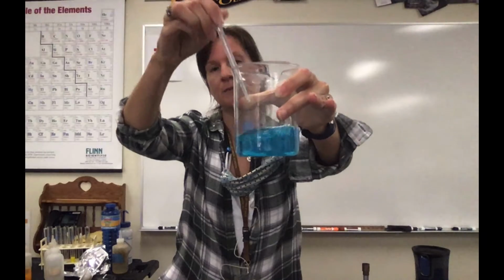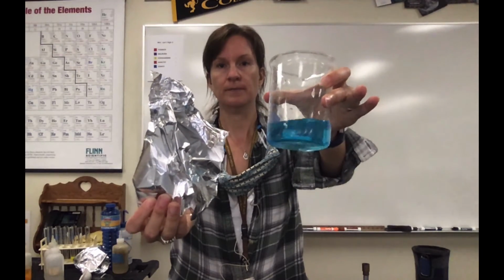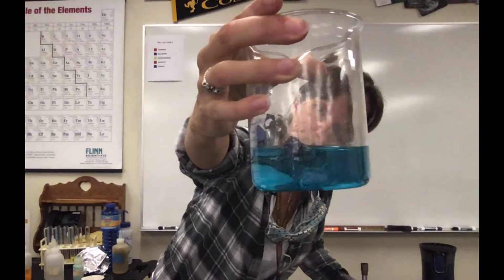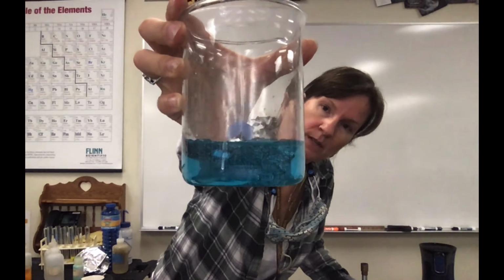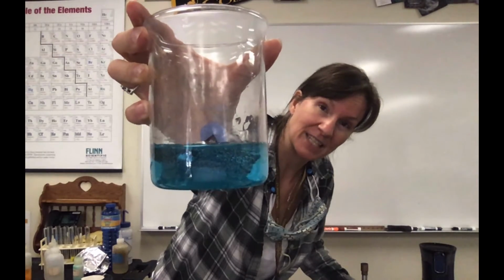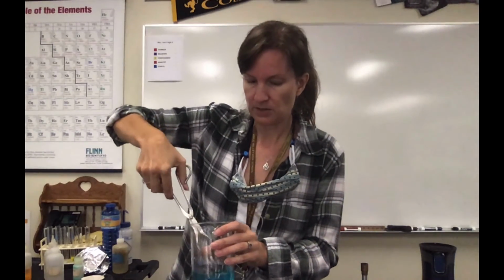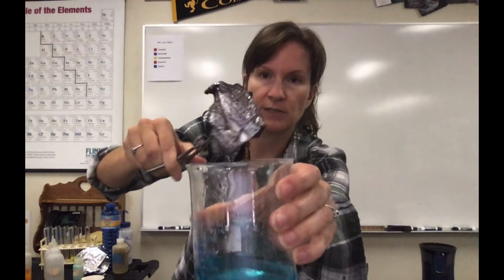For our next one, we're going to use this same solution, this copper chloride solution, and put aluminum foil in it. So observations before. Now, interestingly, the bubbles you're seeing on the surface is because aluminum foil is coated with something to help it from reacting with water and the things around it. So as those bubbles come off, that's when we see the copper chloride reacting with the aluminum. And you can see that it starts to look pretty rusty. Okay, so observations, and then chemical or physical in relation to this.